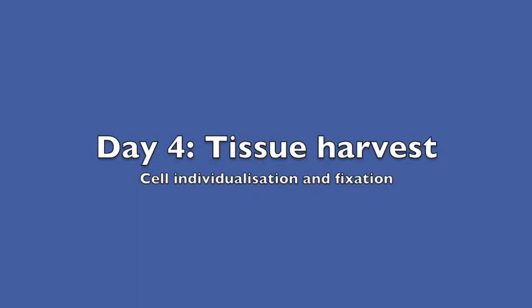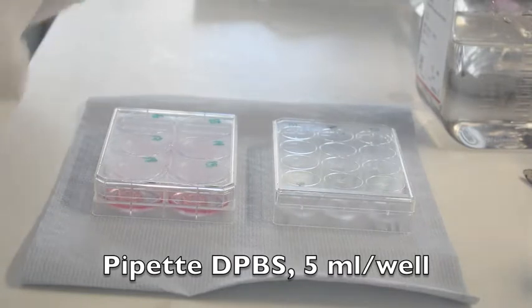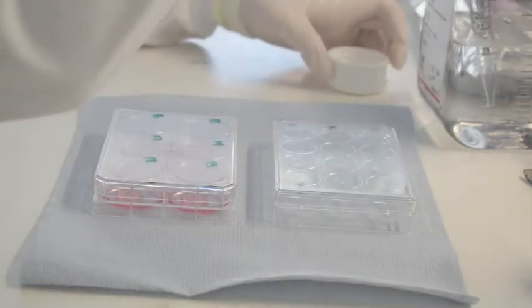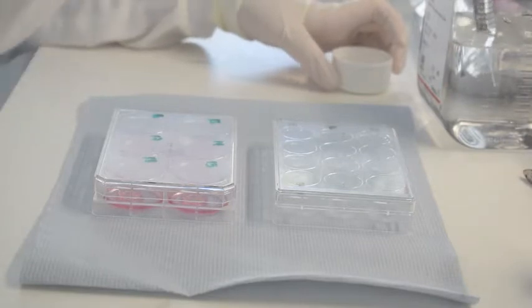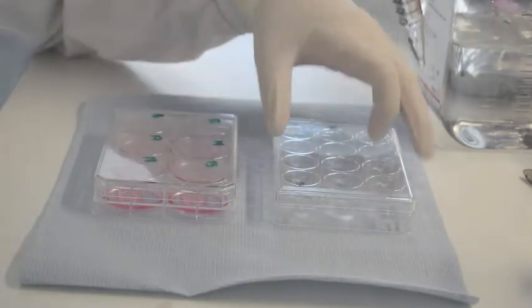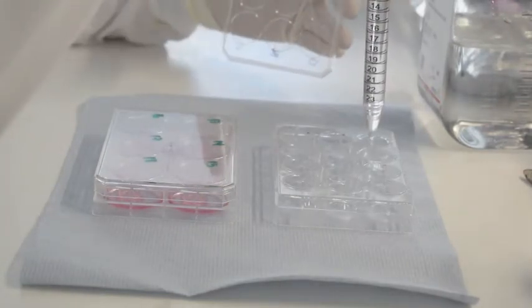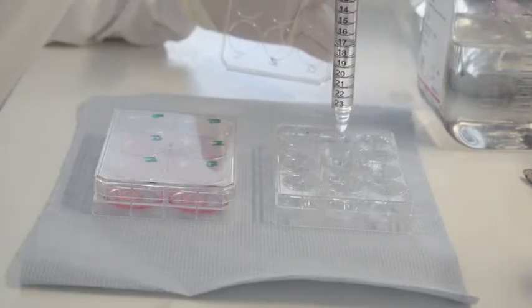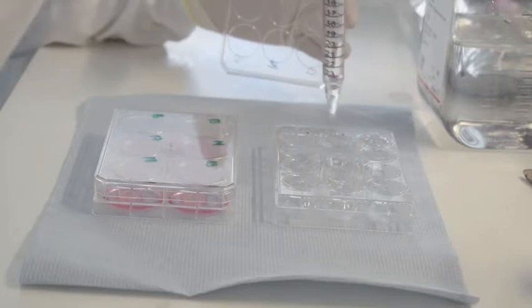Day 4 tissue harvest for micronucleus analysis. 5 millilitres of Dulbecco's phosphate buffered saline is added to 3 wells of a 12 well plate.